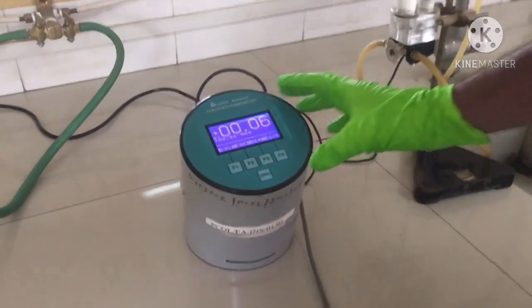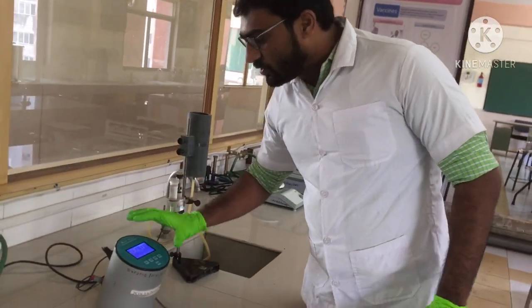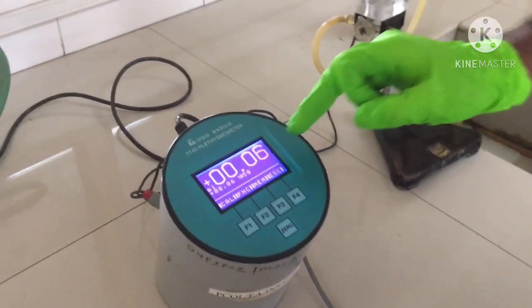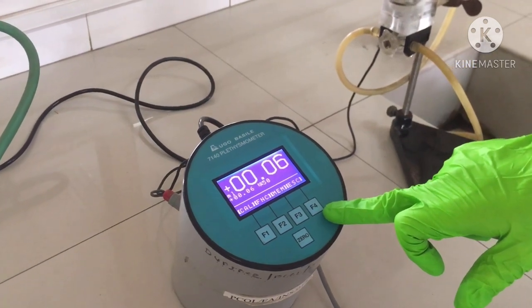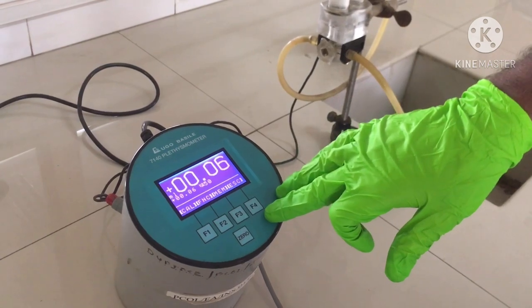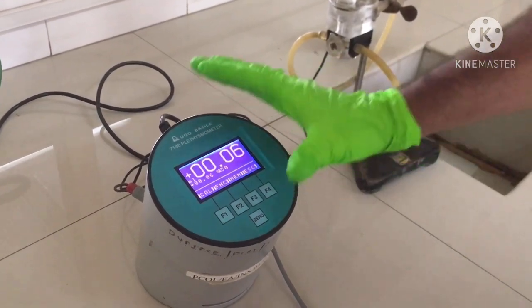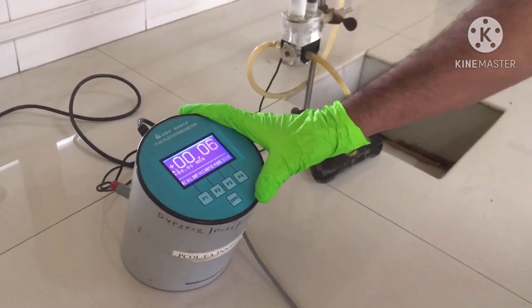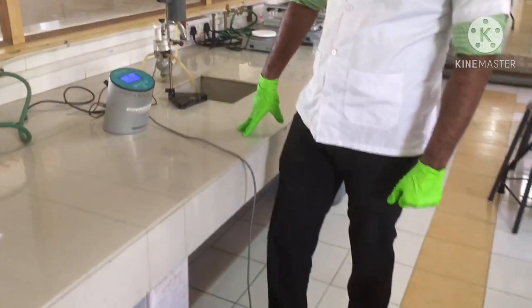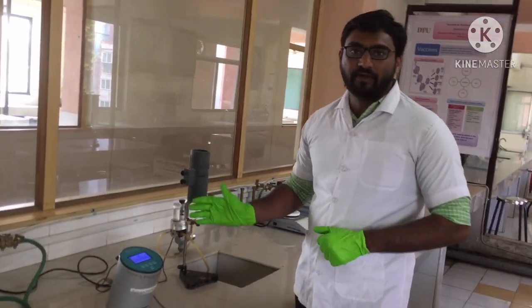You can see this is an electronic unit which has a microprocessor inbuilt into this instrument. All the connections are behind this instrument. You can see this is a screen where we can see the actual reading of the inflammation. There are different function buttons: F1, F2, F3, F4, and 0. These buttons are used for going up and down, setting the date, calculations, or going back on screen. Below this is a pedal which we can use for recording the inflammation data. In the water cell, we have to dip the paw of the rat or the mouse to evaluate anti-inflammatory activity.